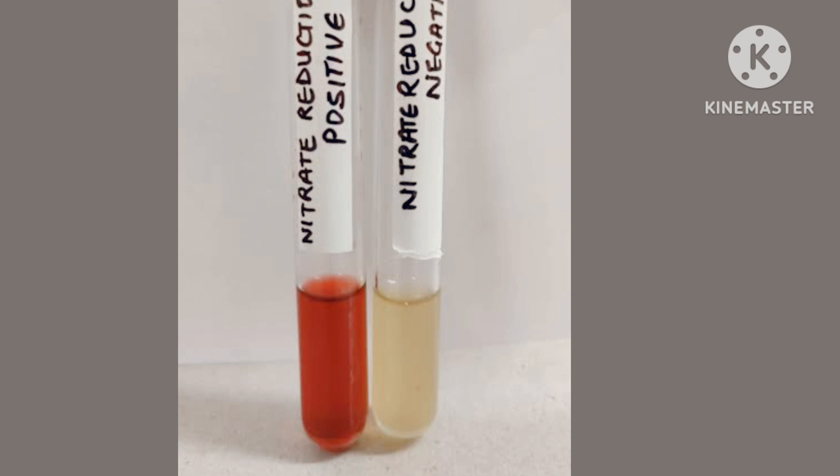Escherichia coli ATCC 25922 is used as the positive control and Acinetobacter calcoaceticus ATCC 43498 as the negative control. To do the test, inoculate the bacteria in 5 ml nitrate broth and incubate for 24 hours. The next day, add 6 to 8 drops of solution A followed by 6 to 8 drops of solution B.